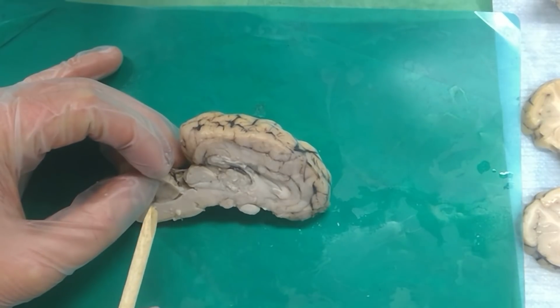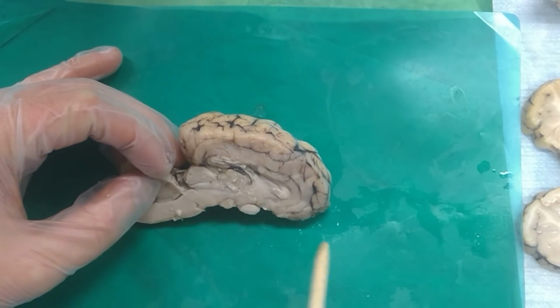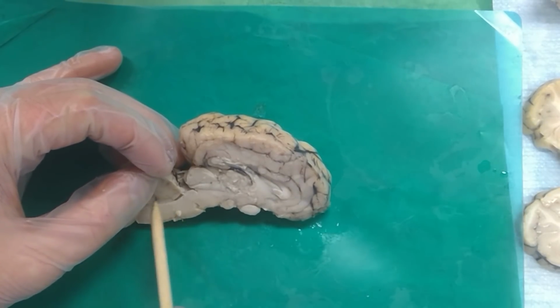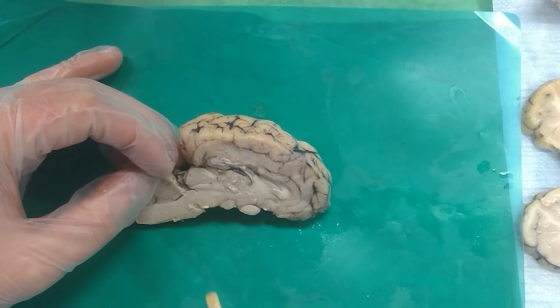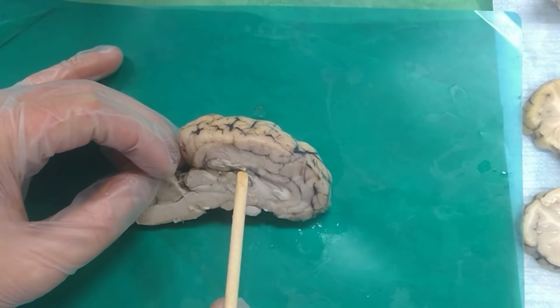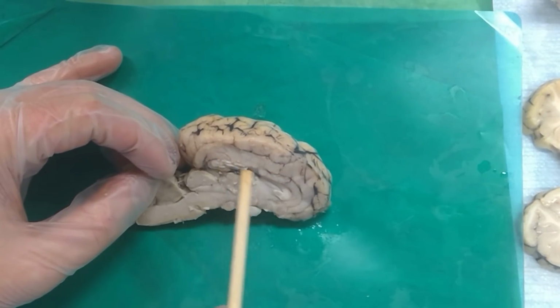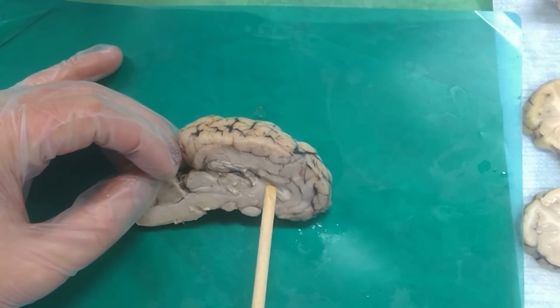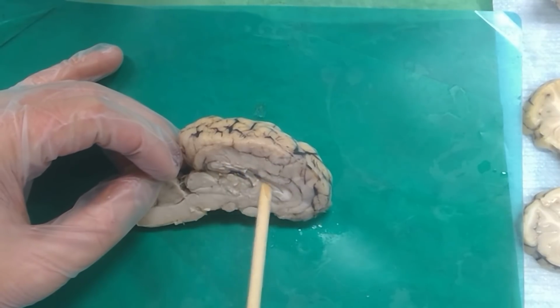Is there anything else on our list here from the sagittals? On the bottom, you said the pons and the... Yeah, this is the medulla right here, and this is the pons right here. Where's the fornix? Fornix is this guy that's running along. It's the white fibers that make up the bottom part of the lateral ventricles. So you got the white fibers of the corpus callosum making up the top of the lateral ventricle. You got the caudate making up the lateral wall of the lateral ventricle, and you got the fornix making up the floor of the lateral ventricle.